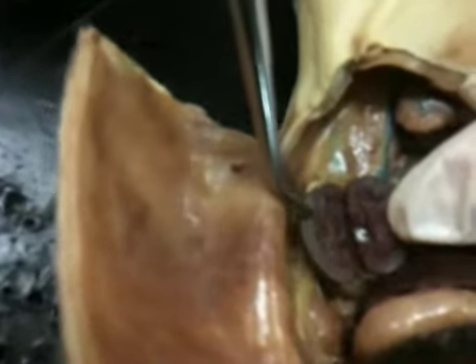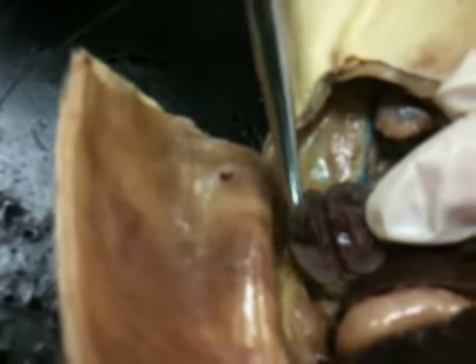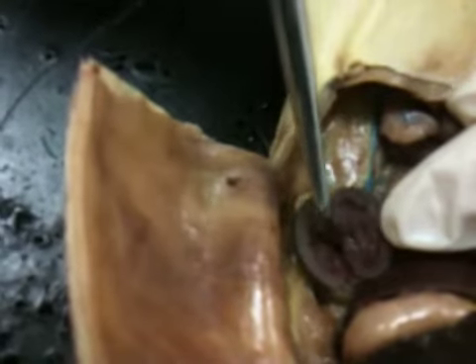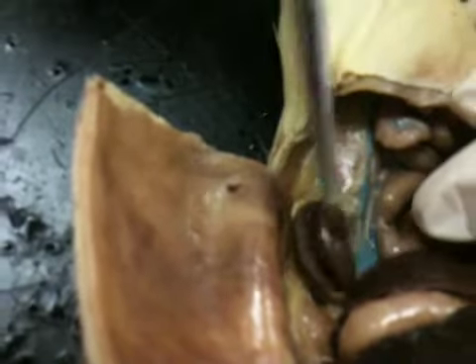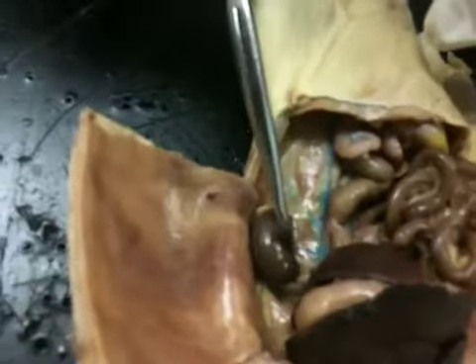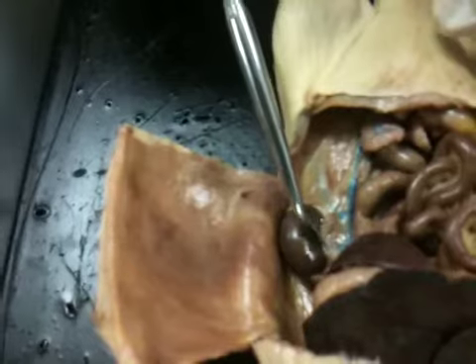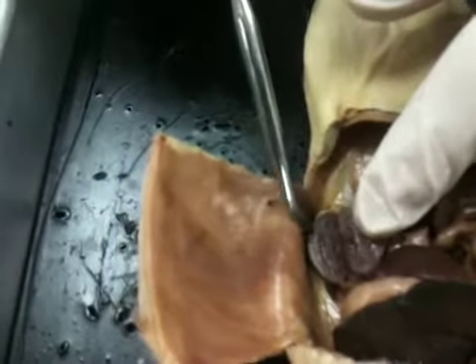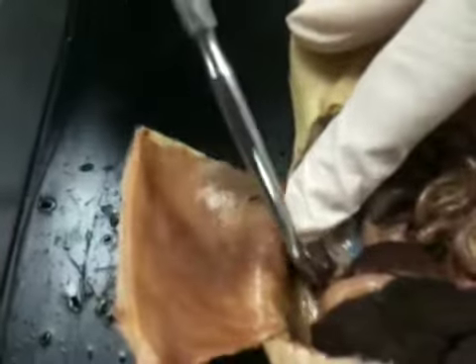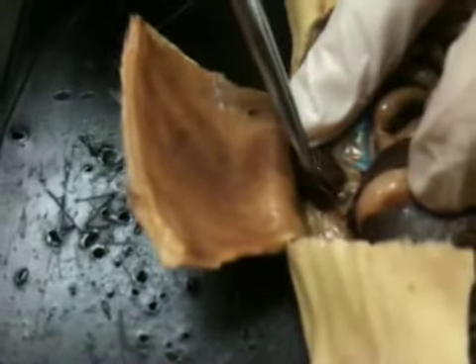Here's the cortex on the outside. Here's the medulla on the inside, a different color. And then right there in the middle, that is a region that we call the hilus. You can also see where the hilus is right here, the inner portion of the kidney where the veins and arteries are going to come in and out of. All right? So again, cortex, medulla. Adrenal gland located right up on top, that little nodule thing.